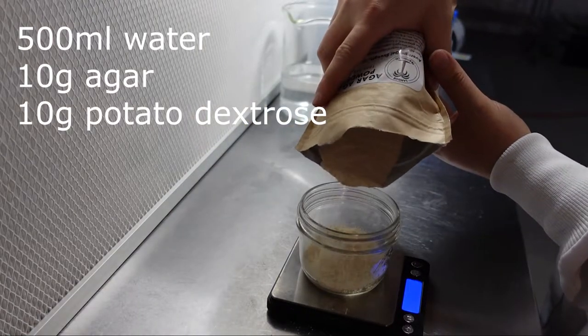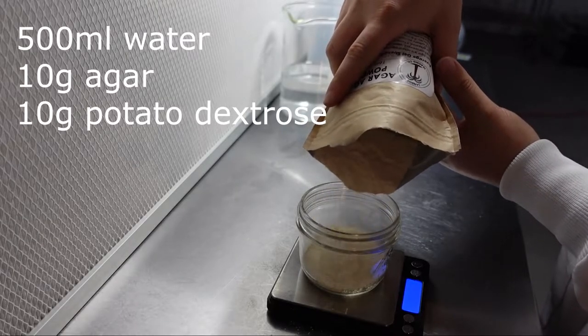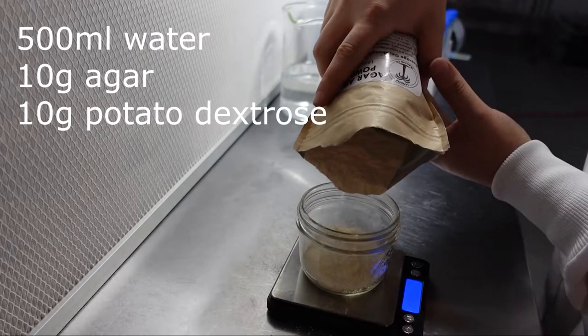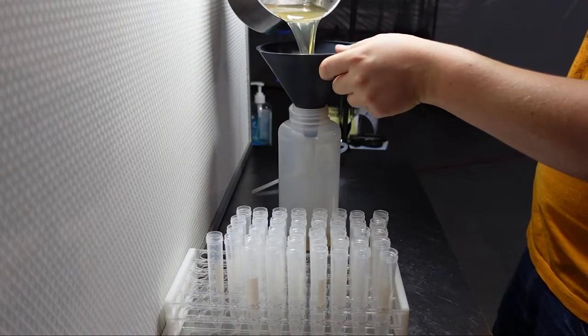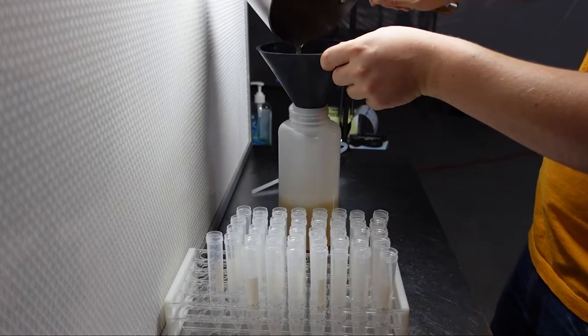Once your media mix is weighed out and ready to go, add the appropriate amount of water and boil until the powder is completely dissolved. Once the powder is completely dissolved, add your mixture to a plastic dispensing bottle.